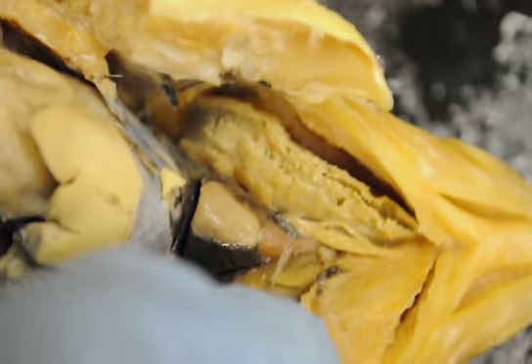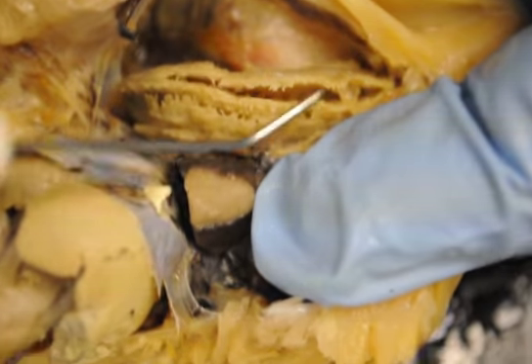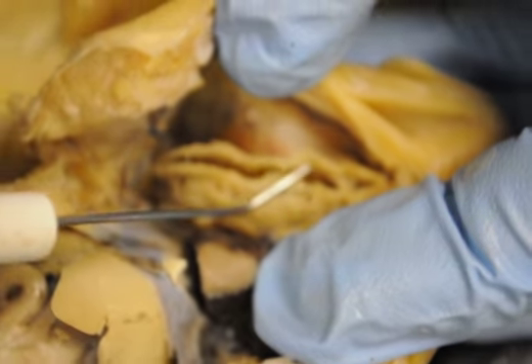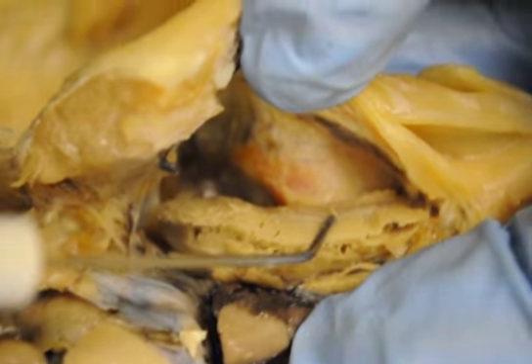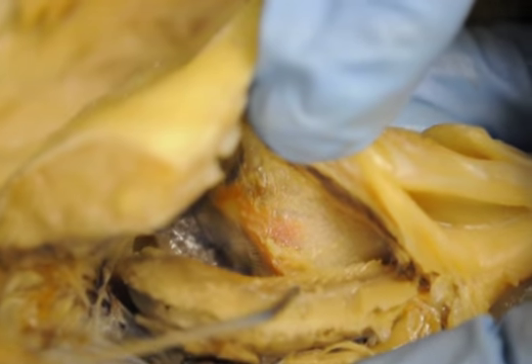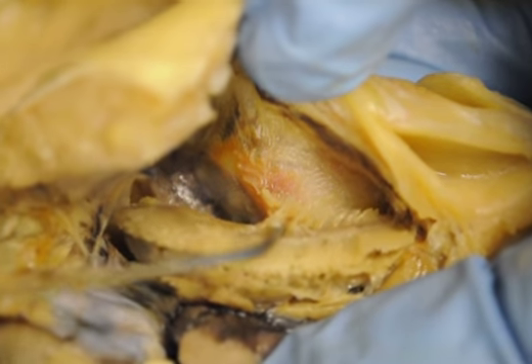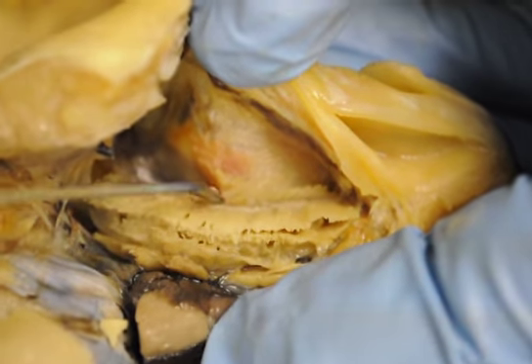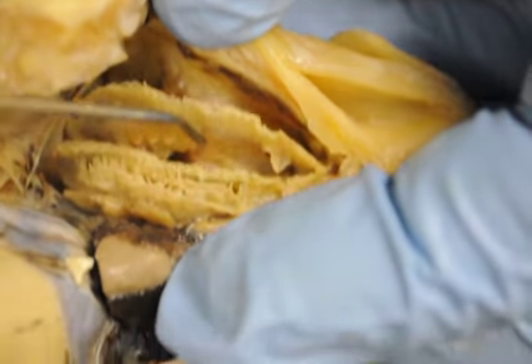Now I'm going to try to pull this aside here so you can see the gills. And I'll show you, these are the gill filaments right here. This is where oxygen and carbon dioxide are exchanged. This hard cartilaginous area here is the gill arch. And then behind it, I'm going to lift these up and you can see the gill rakers. See all those teeth on there? That's the gill rakers. That's designed to help keep food out of the gills. So we have the gill rakers, the gill arch, and the gill filaments.